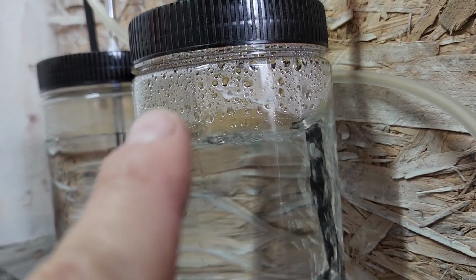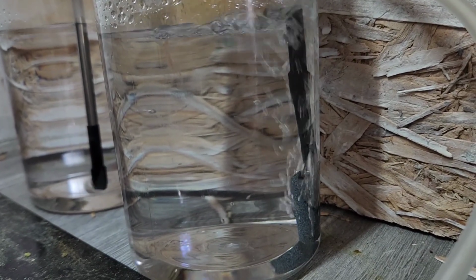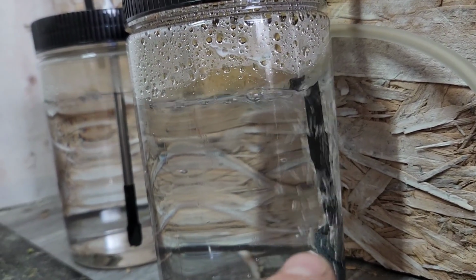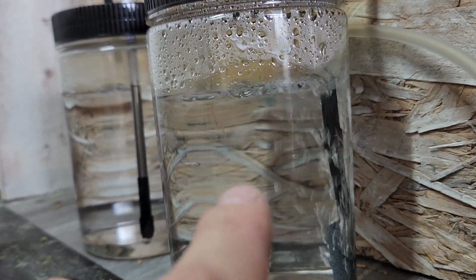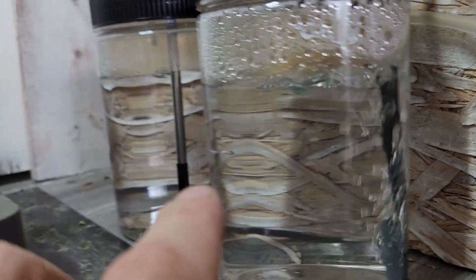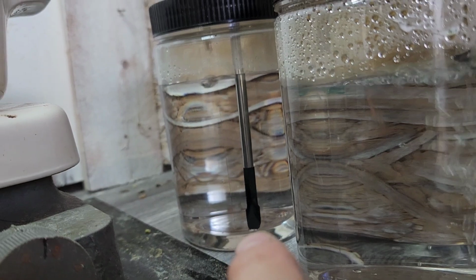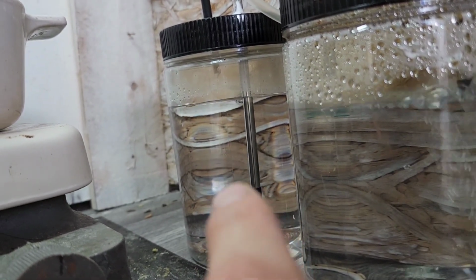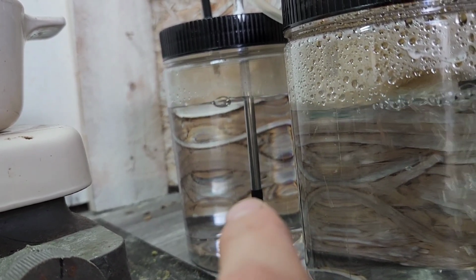But what we do have to get is possibly a bigger apparatus. We probably don't have enough liquid here, or time for these air bubbles to basically transfer the nitric to the water. And that's what I was hoping for in the second one, but because of my leaks, we're not getting that nice bubbling through here. With those big bubbles coming out, you're not getting any surface area, so you're not getting hardly any transfer of the nitric.